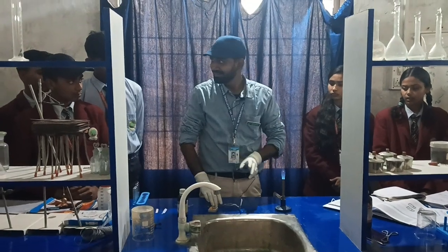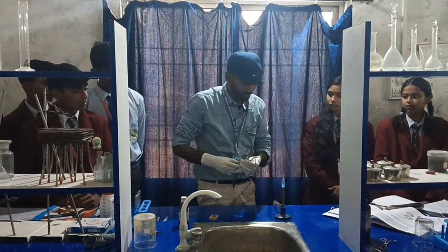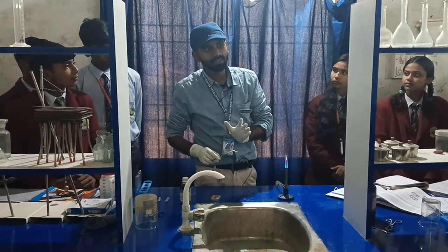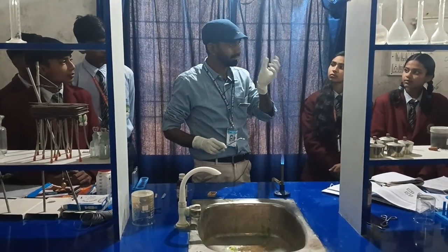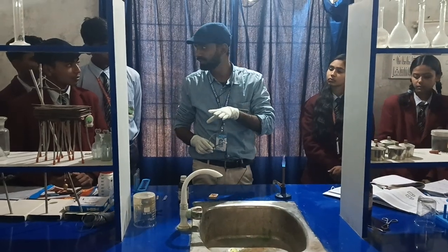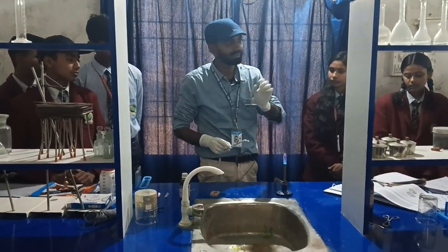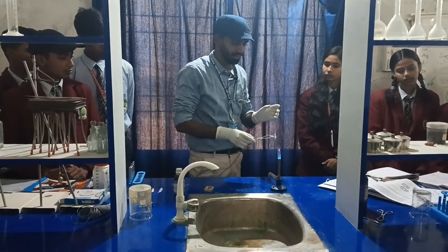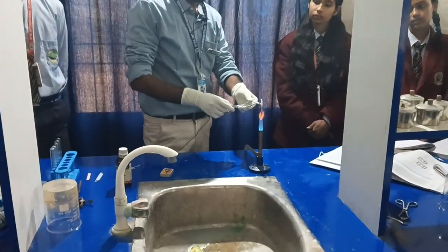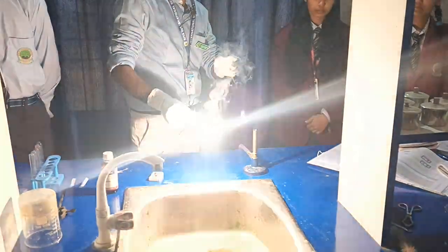Since we have already cleaned it, we will burn it now. This will burn with a dazzling white light, so be cautious — don't look at it directly for a very long period. Watch briefly and then look away. It burns with dazzling white light.